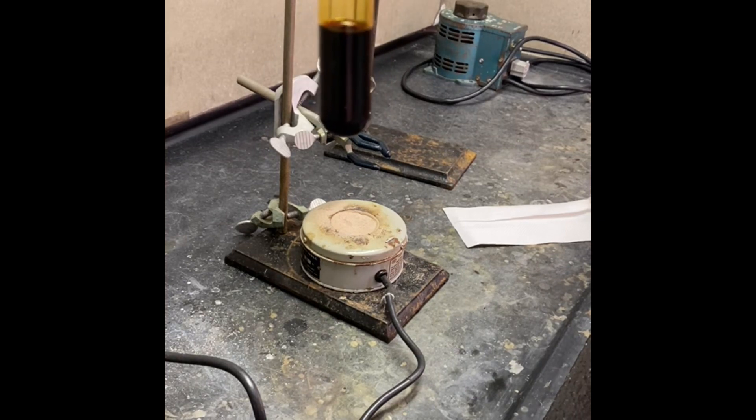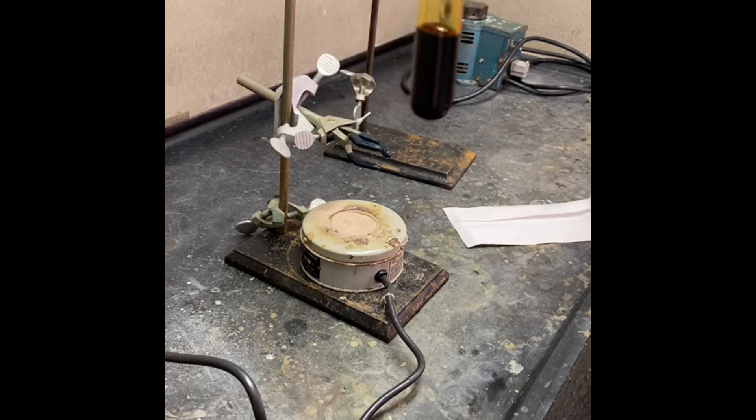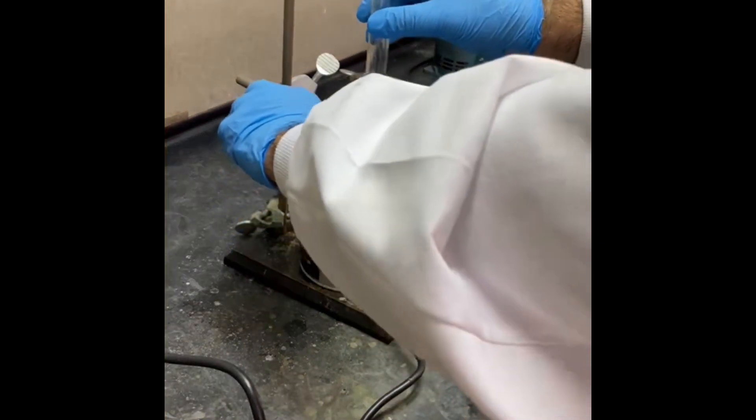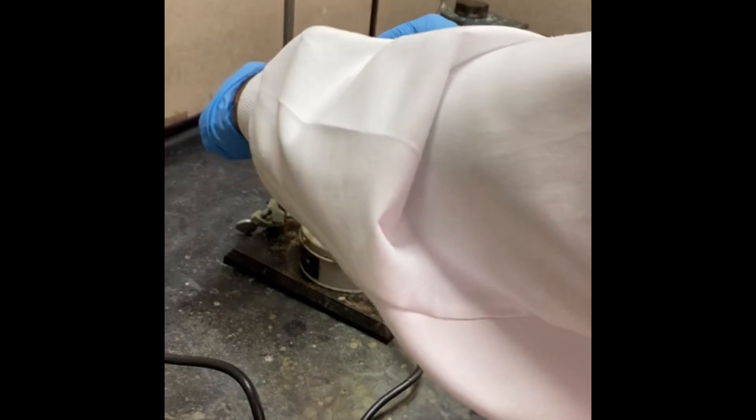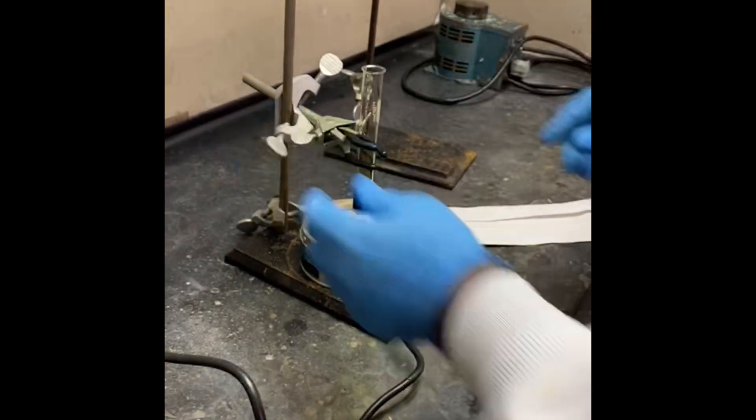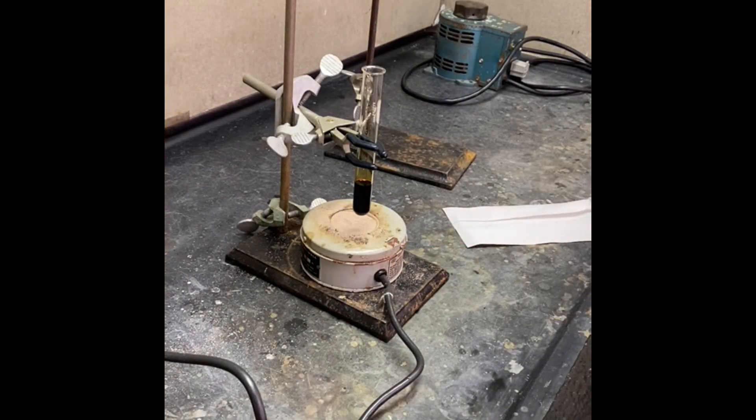Now I'm going to put that back in the clamp, and we'll add the sodium hydrosulfite.